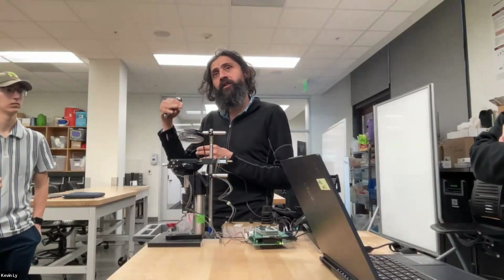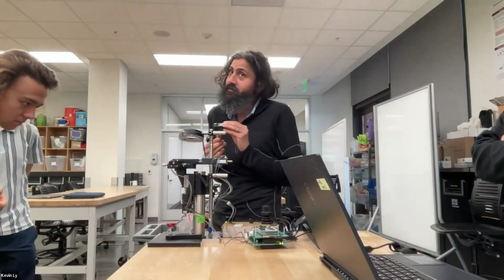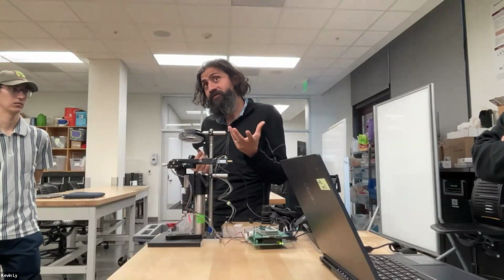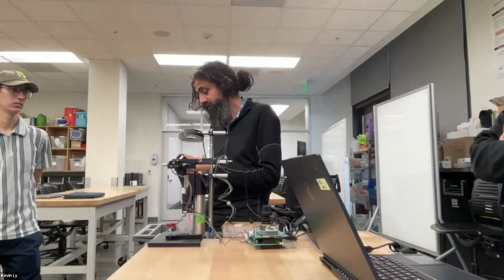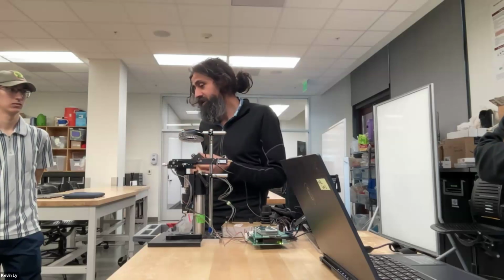So as the number of photons keeps getting down and down, you need a high quantum efficiency camera. Now you can find lots of awesome cameras, and then you can spend your year trying to find drivers for them, because most of these companies don't release drivers. So it's also the fact that these had good drivers, people had written sets of drivers around. So that's one key component. If you're going to make a microscope or imaging systems, you start with this.